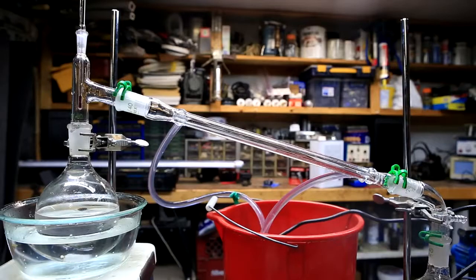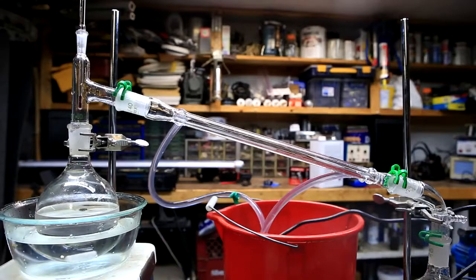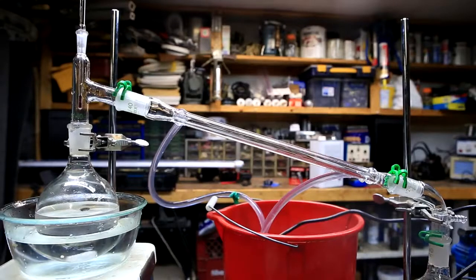Another distillation was carried out to recover the DCM. When all of the DCM had been removed the yellow oil which remained was transferred to a dram vial.